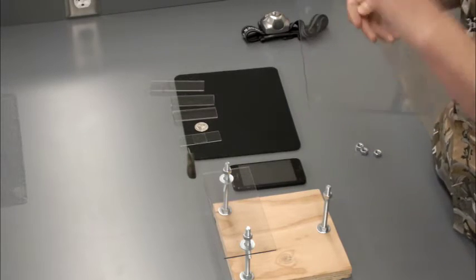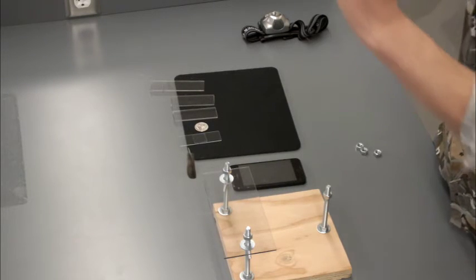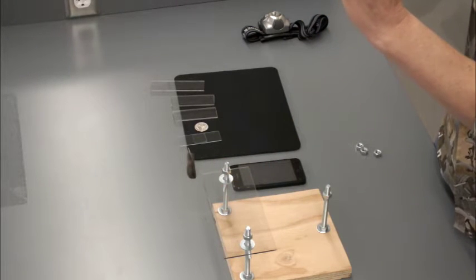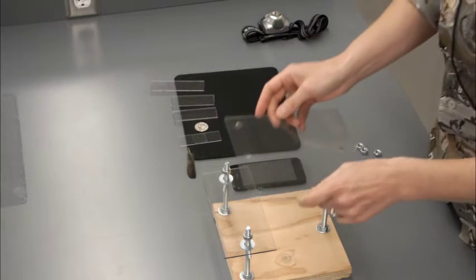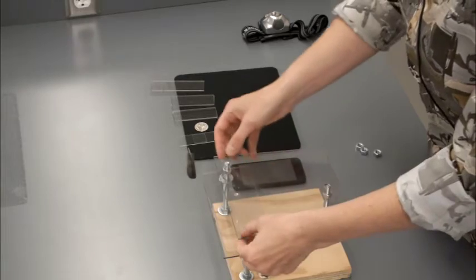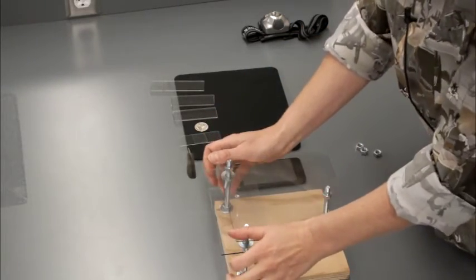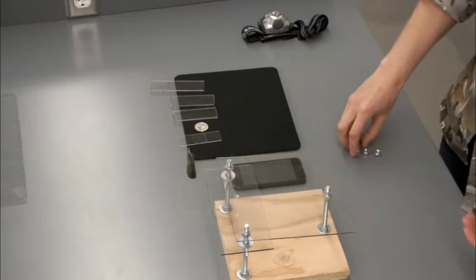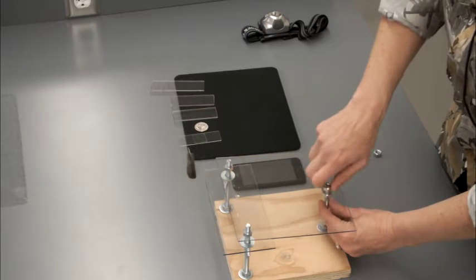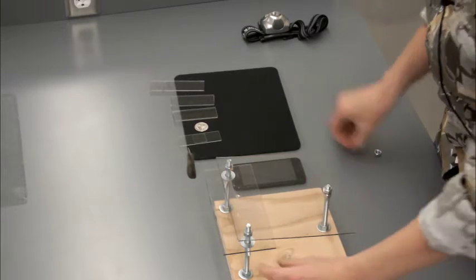If you remove the tip of your laser pointer, you can actually remove that lens, drill a hole in the center between these 2 bolts right here where they're going to go, and you can insert the lens into the piece of plexiglass. And that is the magnifying lens that we're going to use to take a look at the different specimens that we have. All right, so once you've got everything drilled and all in alignment on there, you're going to put that camera stand on top. Put your bolts on so that it doesn't move around on you.